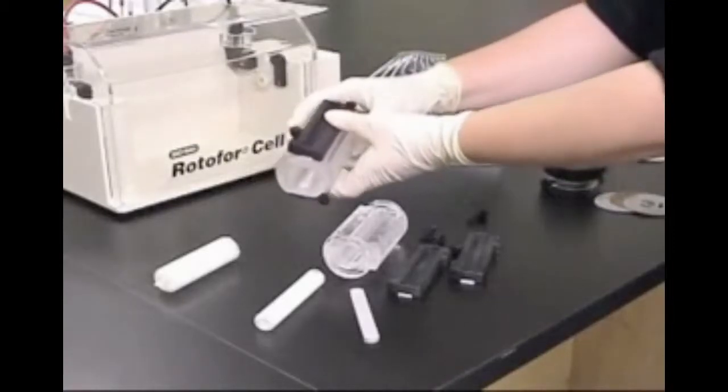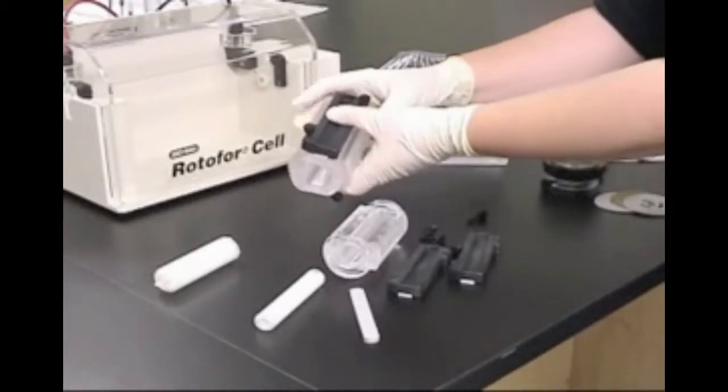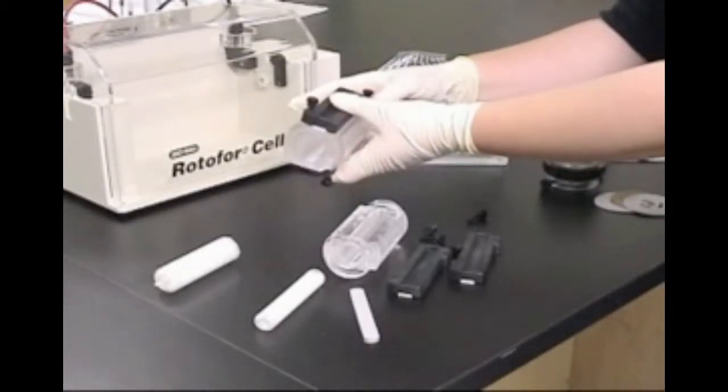We'll begin by preparing the focusing chamber. Let's first take a closer look at the features of the focusing chambers.